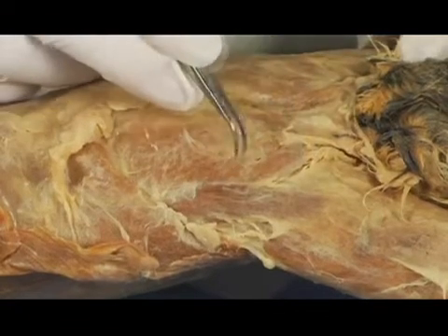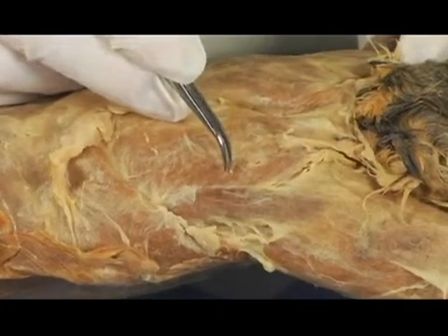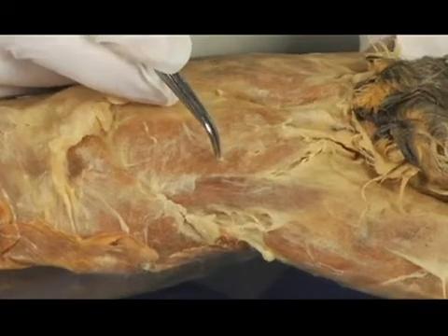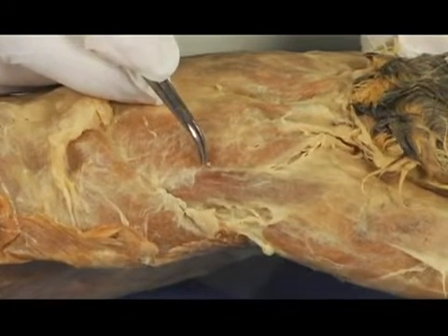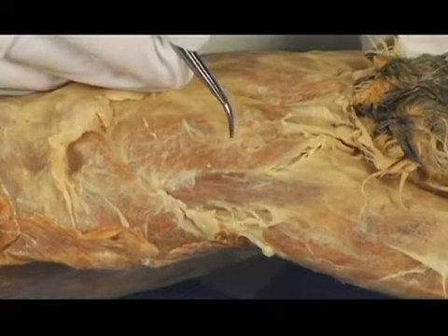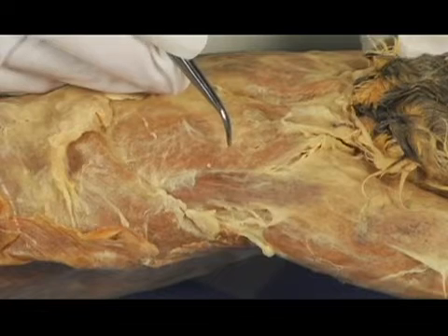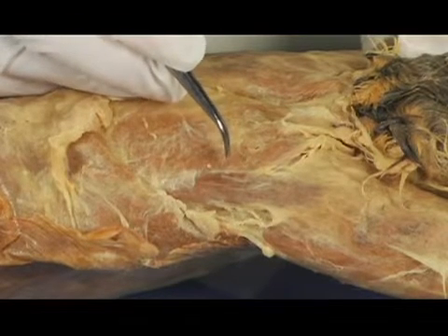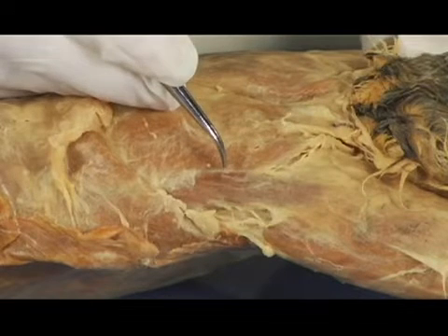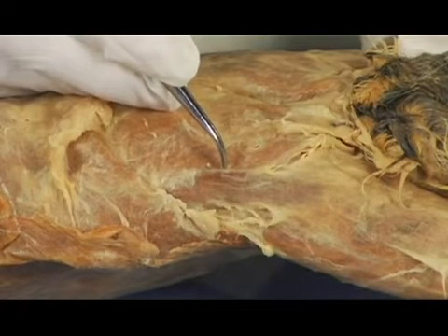Now in your shoulder area, you have a muscle called the deltoid. You're probably aware of that. It's a large muscle, helps to lift your arm. The cat has a similar situation. Their limbs are organized a little bit differently. They have some separations of muscle. Like I said, we have a deltoid. They have several deltoid muscles. And one of them is called the spinodeltoid.